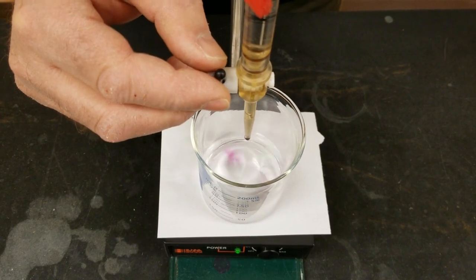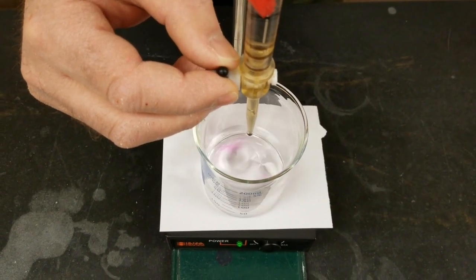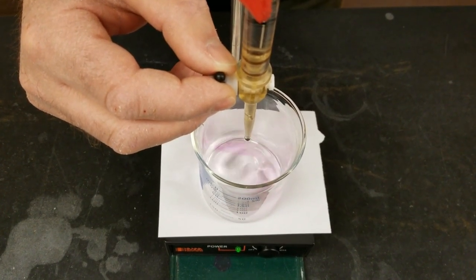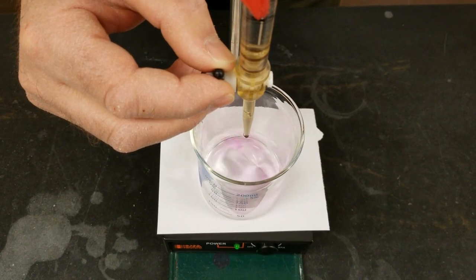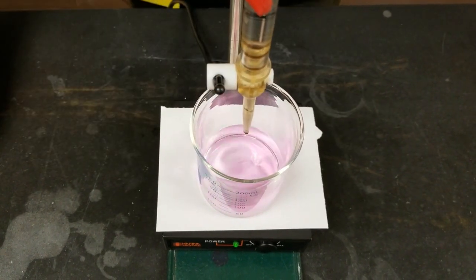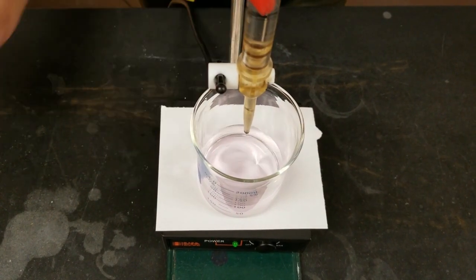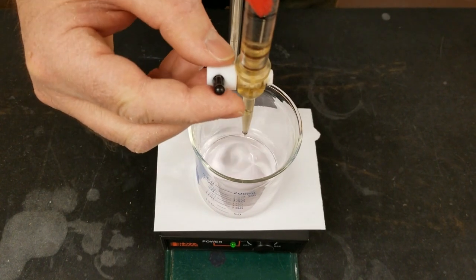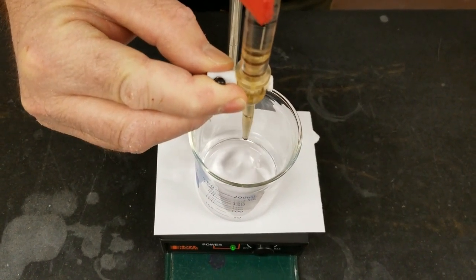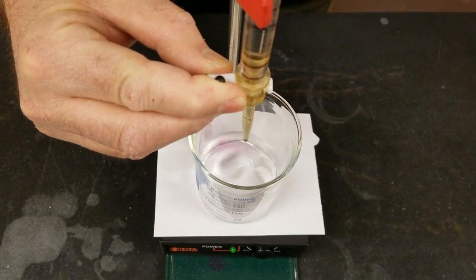Okay, so you can see those flashes of pink lasting longer and longer. Still some H+ there. Okay, so I'm going to slow it down. Looks like we're almost at the equivalence point, but you'll notice that it's cleared up. So now I'm going to slow it down and go drop by drop. Really careful with the burette.